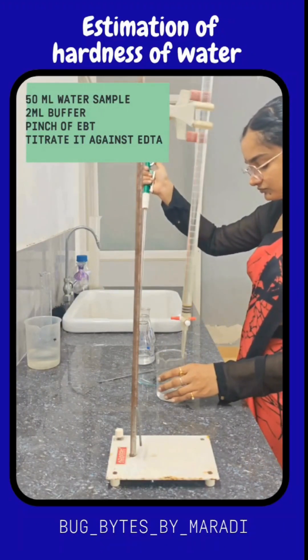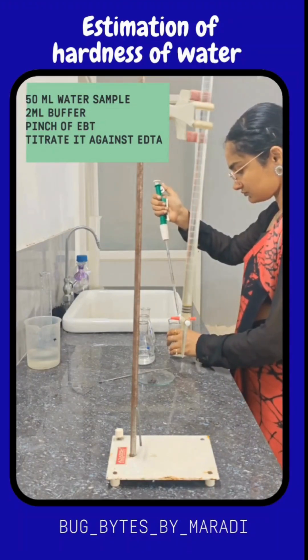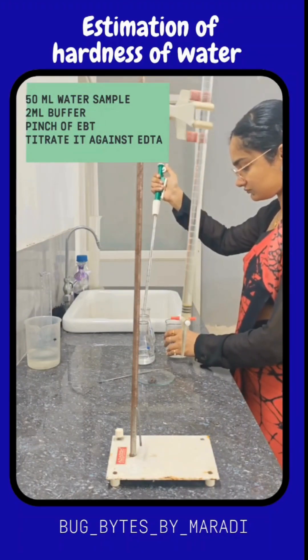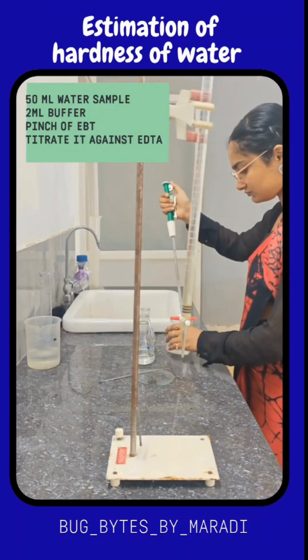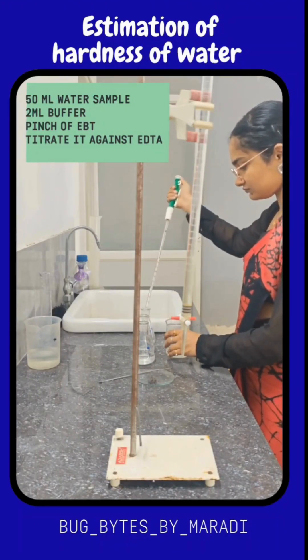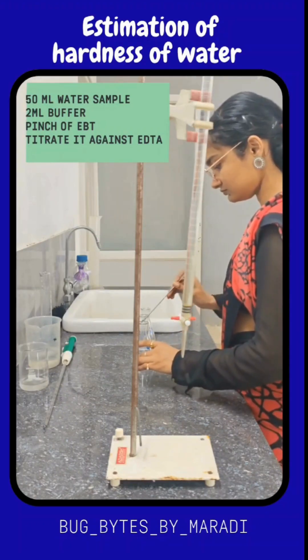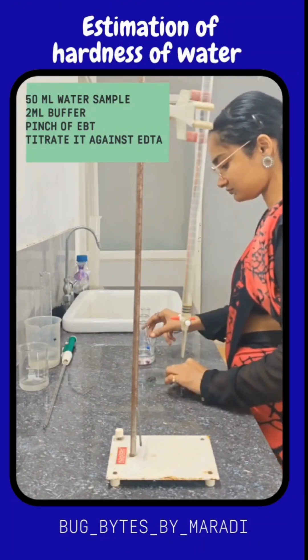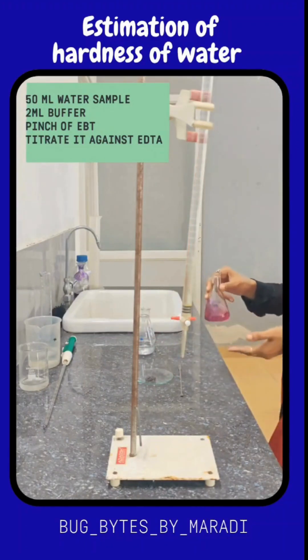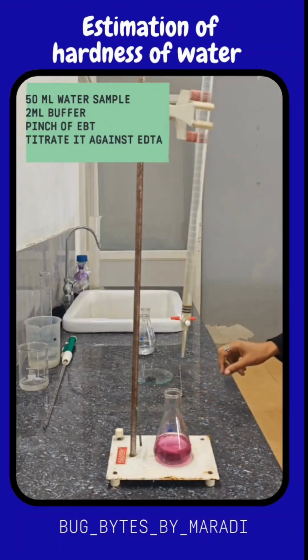EBT is going to interact with the calcium and magnesium ions and forms a complex of wine red color. This wine red color complex has to be titrated against 0.1 molar EDTA. When you titrate against EDTA, the EDTA is going to bind with calcium as well as magnesium, which is actually stronger compared to the EBT, and it starts to take the calcium and magnesium away from the EBT.